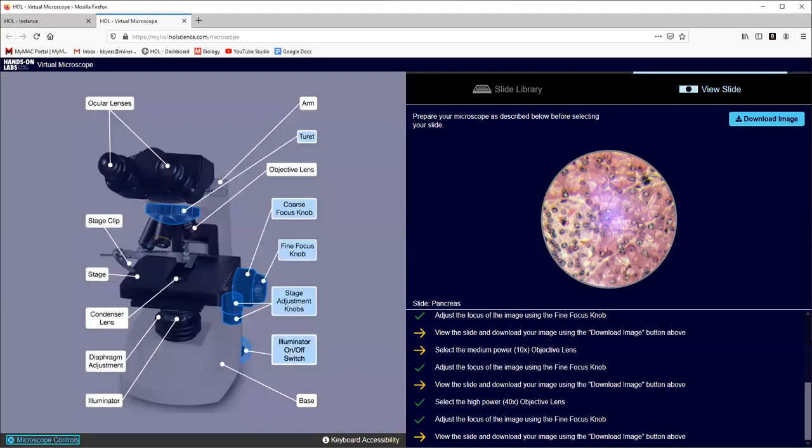Let's just go through the controls really fast. Ocular lenses, that's what you'd be looking at. The arm is how you would carry the microscope. These objective lenses come in scanning, low, and high. You always start on the short lens, the scanning lens. You can use the focusing knobs or adjustment knobs, coarse and fine, to move that stage up and down. When you're on the low and high power, you never use coarse focus because you could break your lens, but you can use the fine focus knob. You can move that stage around. The stage has a clip which would hold your slide in place.